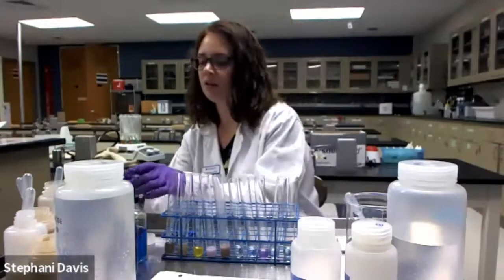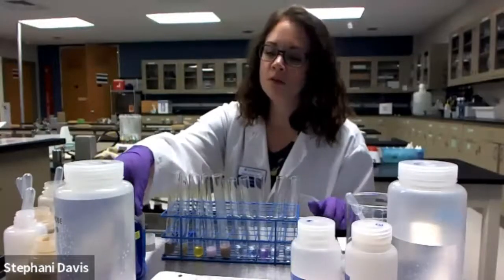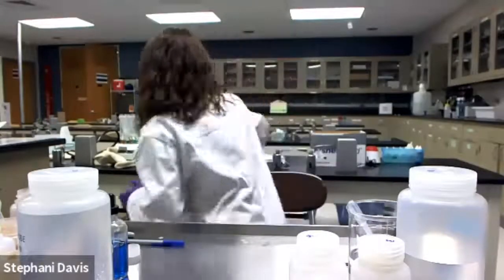Okay, so again, I'll post pictures of these so you can look at them carefully and fill out a table indicating which ones were positive and which ones were negative. Okay, so that completes our test for the Biuret reagent, which again tests for the presence of proteins. Okay, so it's been 5 minutes. Let's go ahead and take a look at our Benedict's test. These are really hot, so I'm going to take them out using this clamp.